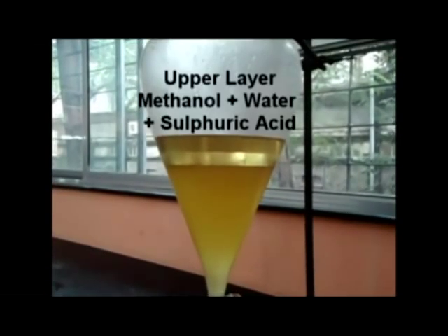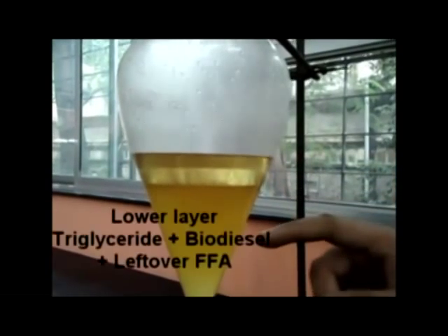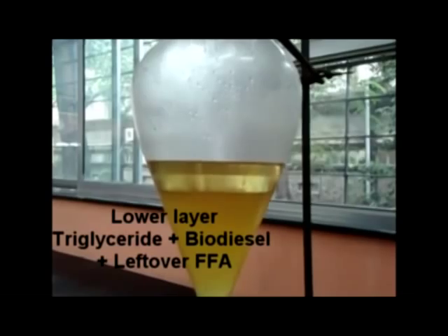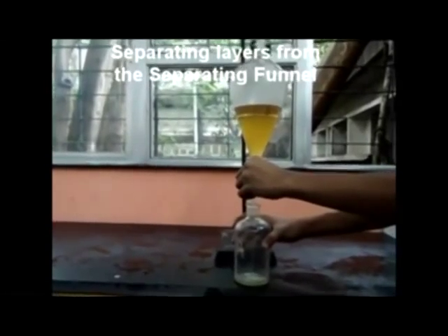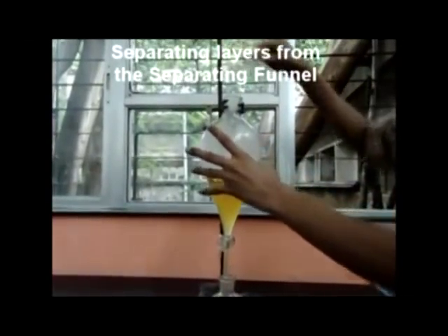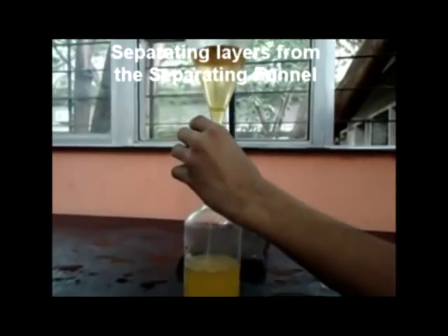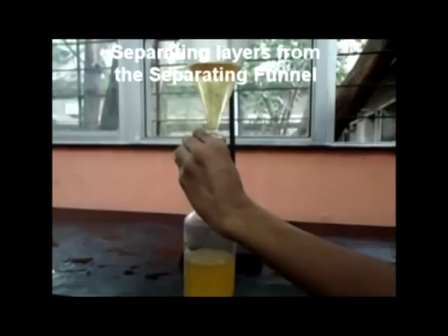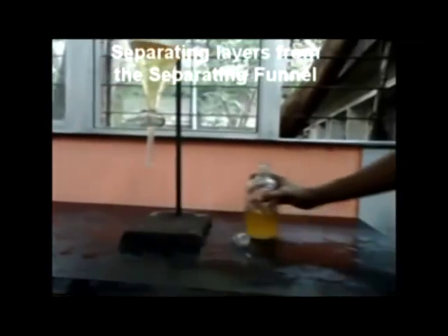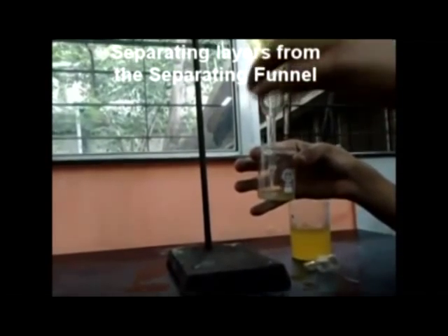The mixture separates into two layers due to polarity difference. Generally the upper layer consists of methanol, water, and sulphuric acid, while the lower layer consists of triglyceride, biodiesel, and leftover FFA. Weigh an empty beaker, pour the TG layer into it, remove the cap of the separating funnel, and close the tap as soon as the TG layer has been drained. Then weigh the filled beaker to determine the weight of the TG layer. Similarly empty out the acidified methanol layer.